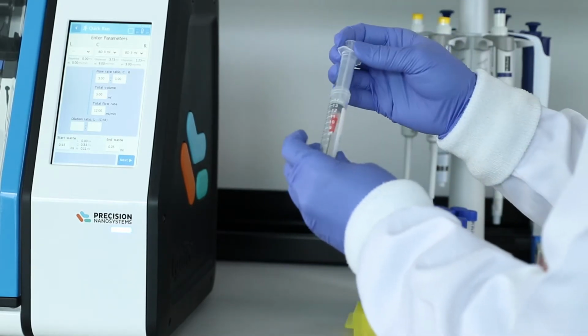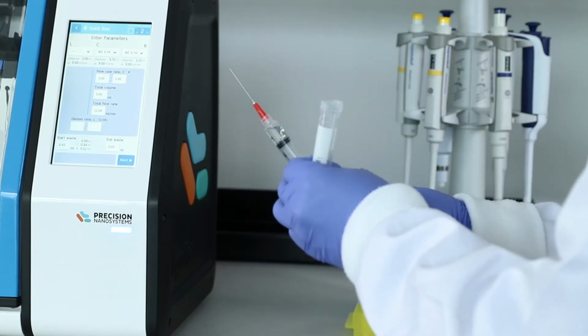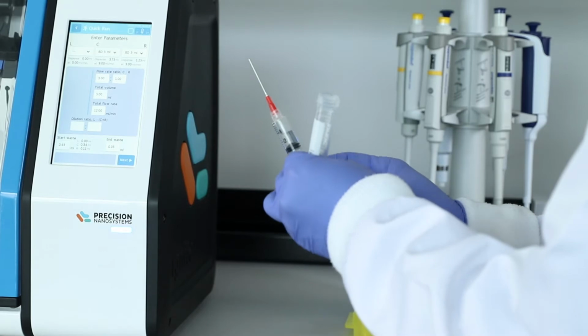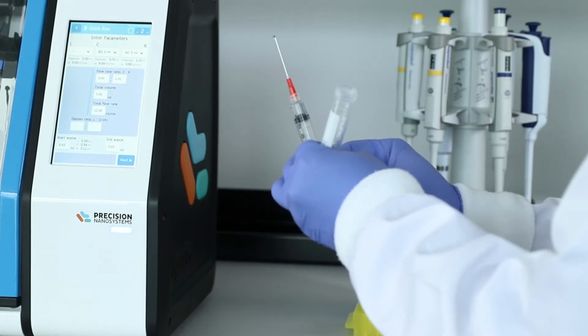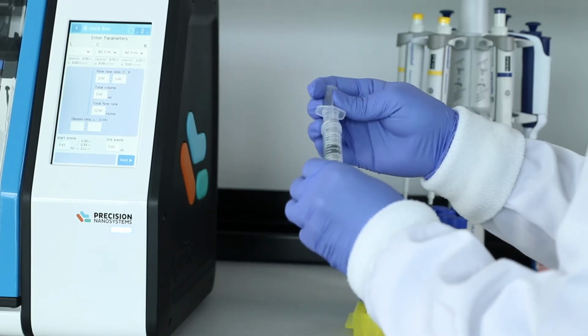Fluid input is handled through syringes which attach by Luer lock directly to the Ignite cartridge. Here, RNA in an acidic buffer is loaded in a syringe. Then our Genvoy ionizable lipid mix dissolved in ethanol is loaded in another. The Ignite will inject these into the NxGen mixer under the conditions specified to control the nanoprecipitation reaction.